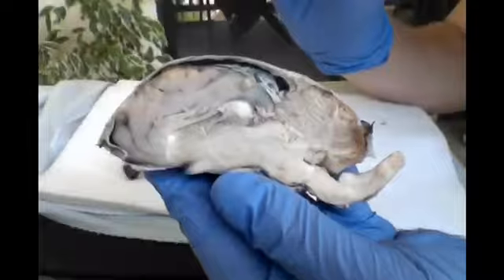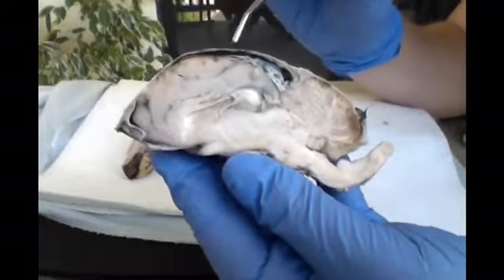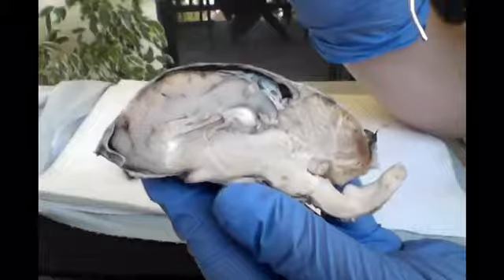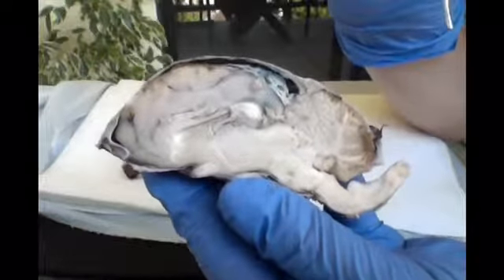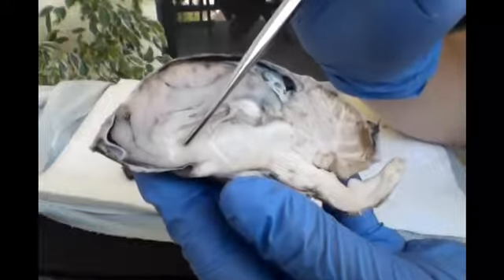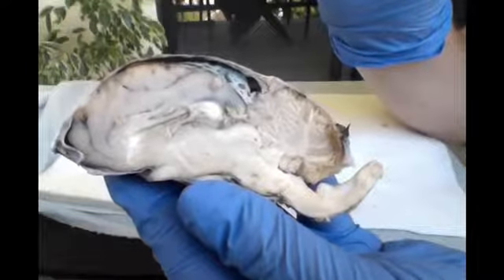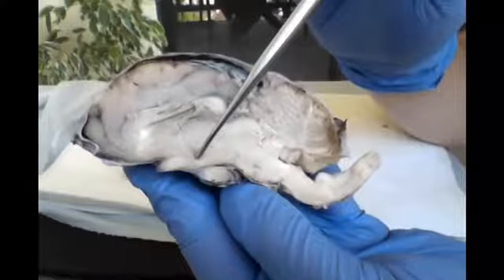Now we're going to look at the sagittal view, and up here we can see is the cerebrum. Here, this curvature formation is called the corpus callosum. Below that, this darker portion is called the fornix. The lateral ventricle is here, and then it moves into the 3rd and the 4th ventricles. Next is looking at the intermediate mass of the thalamus, and that we can see is down here.